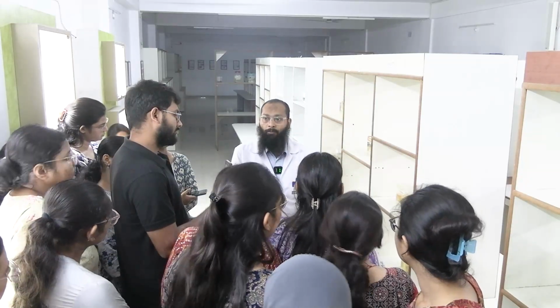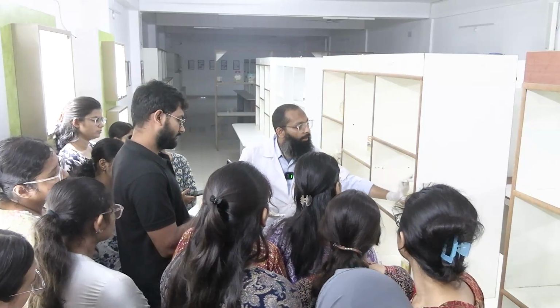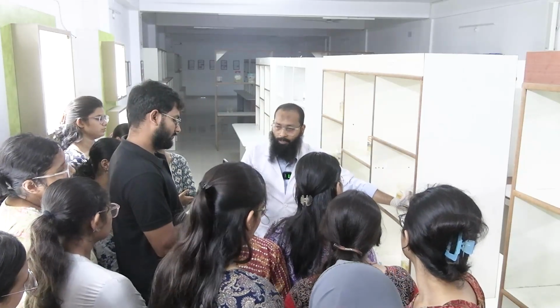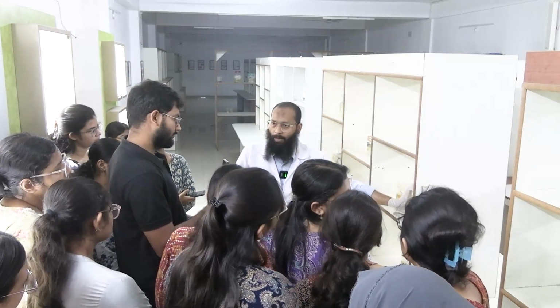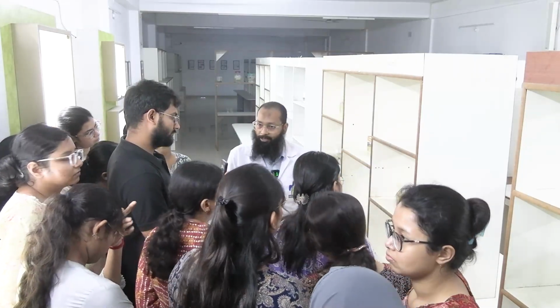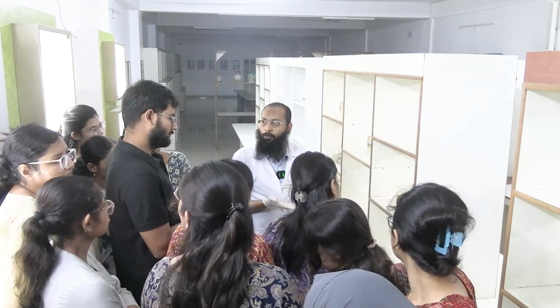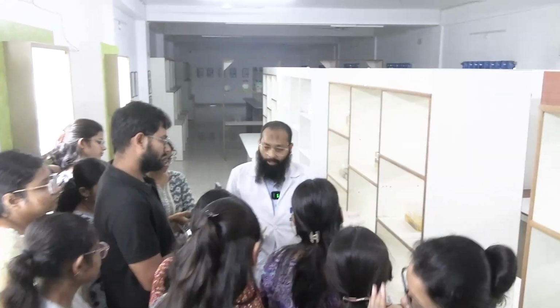But in the examination you will not be given a scale, so approximately you can say this seems to be 7 centimeter by 4 centimeter in dimension. This looks whitish and homogeneous in appearance.